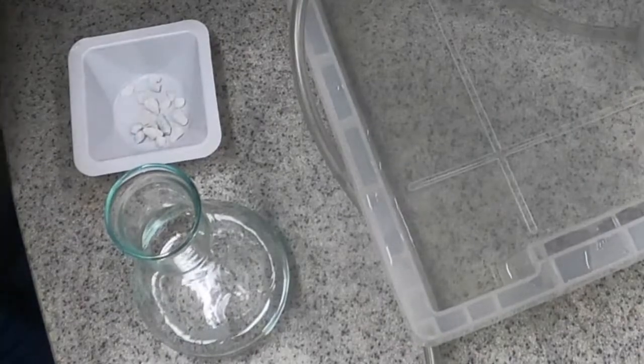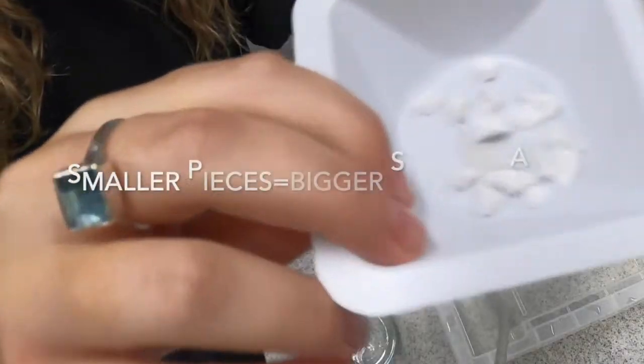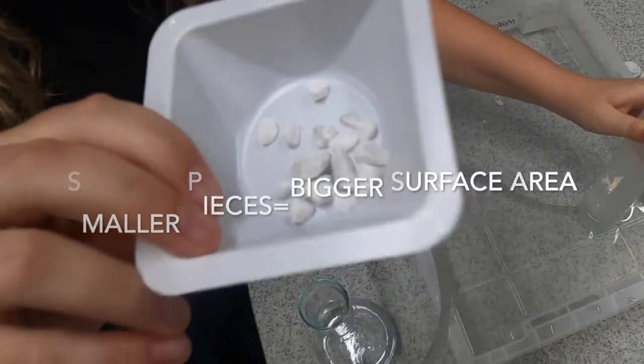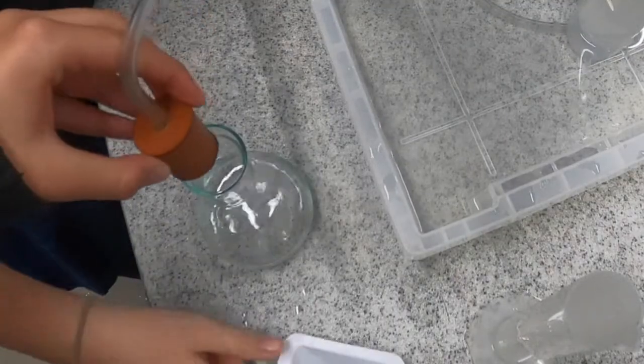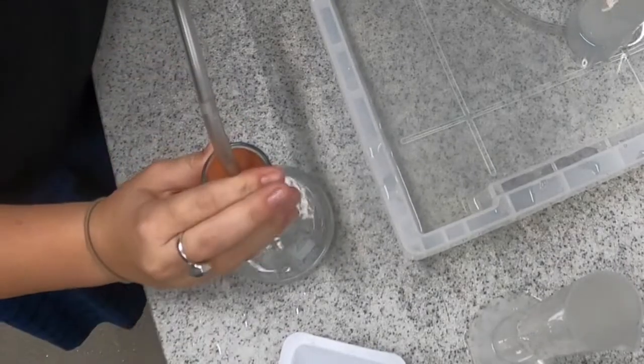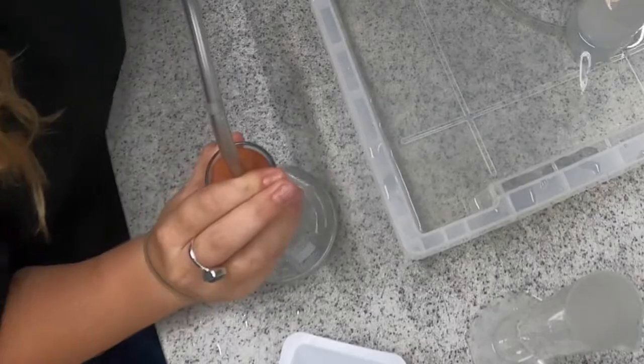We're going to use the same mass of chips each time. So smaller pieces in effect equal bigger surface area, because there's more atoms available to collide with the acid. So we put the stopper in, the chemical reaction has begun, gas is being produced.